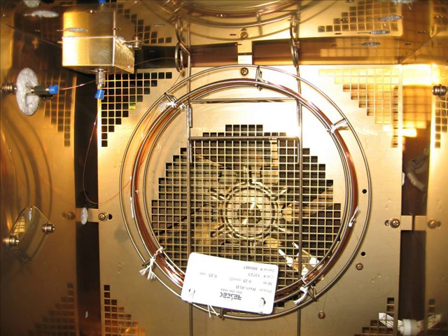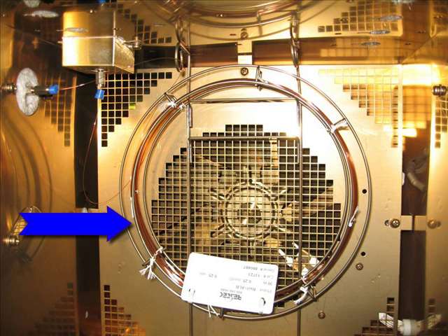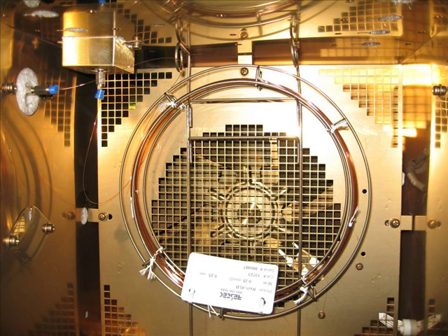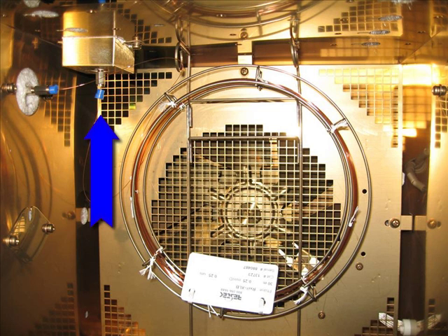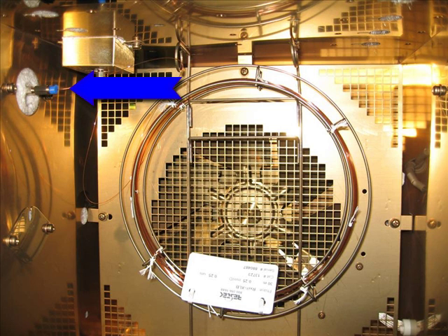This picture shows the capillary column as it is positioned inside the GC oven. It is connected on one side to the bottom of the injector, as shown here, and on the other side to the mass detector.